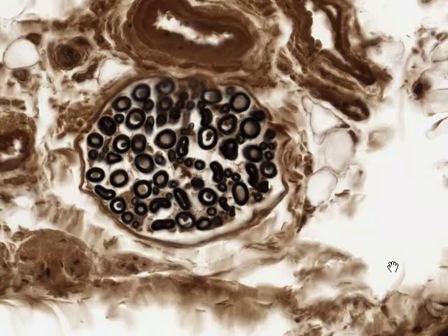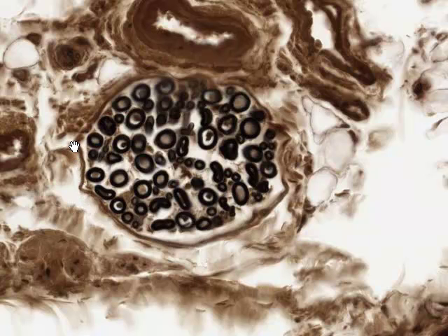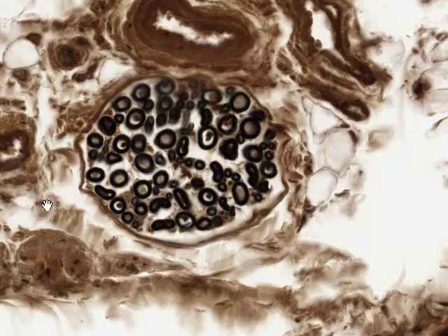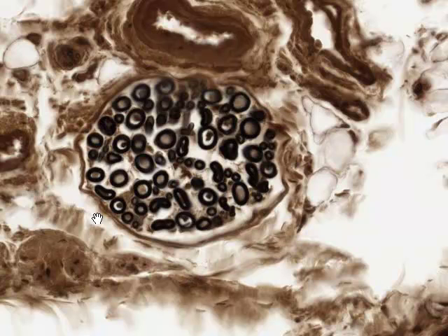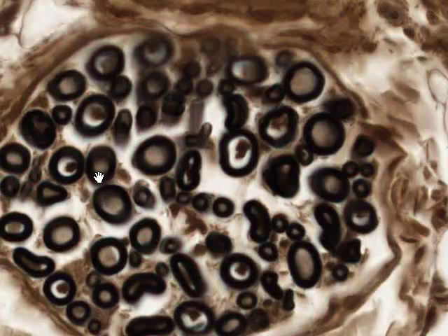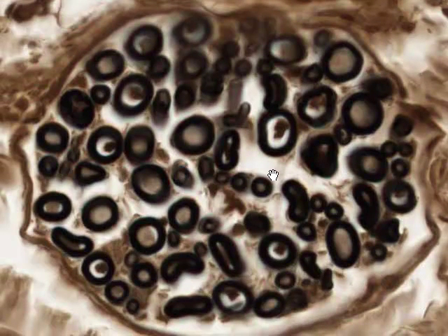Here's another small nerve fascicle stained in a similar but not identical way to the previous one. We can see the connective tissue of the perineurium, or perhaps epineurium for this small nerve, forming a capsule around the nerve bundle. Blood vessels are visible, and there's lots of associated connective tissue. This is actually a small fascicle of a much larger nerve. At higher magnification, we get a very good sense of the myelin stained very black, surrounding the axon. The axon has shrunken back during tissue preparation—visible here as a little brown remnant. This is the classic appearance of peripheral nerves stained for myelin and cut in cross-section.